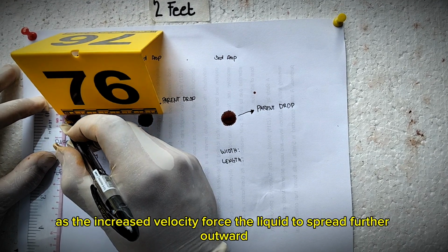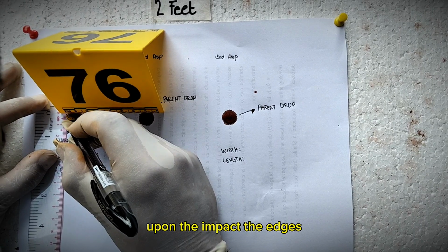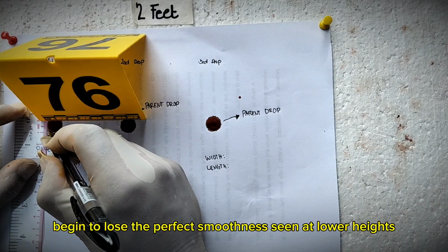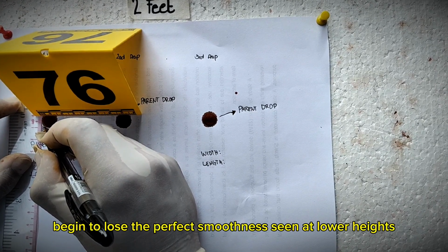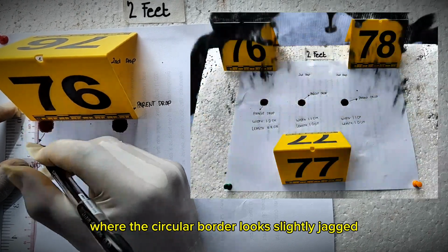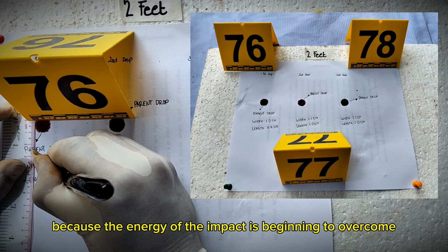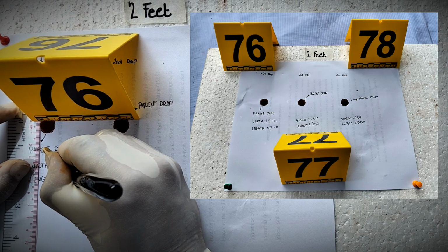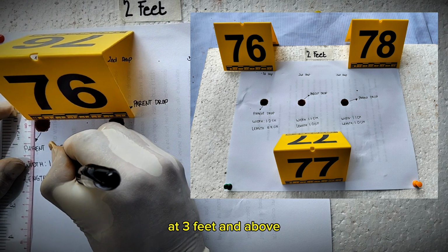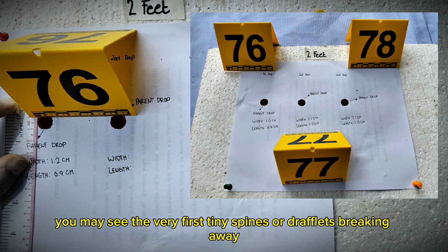As the increased velocity forces the liquid to spread further outward upon impact, the edge characteristics of the stain at 2 feet begin to lose the perfect smoothness seen at lower heights. You might notice the start of scalloping, where the circular border looks slightly jagged because the energy of the impact is beginning to overcome the blood's surface tension. While significant satellite spatters usually become more prominent at 3 feet and above, you may see the very first tiny spines or droplets breaking away at this height.